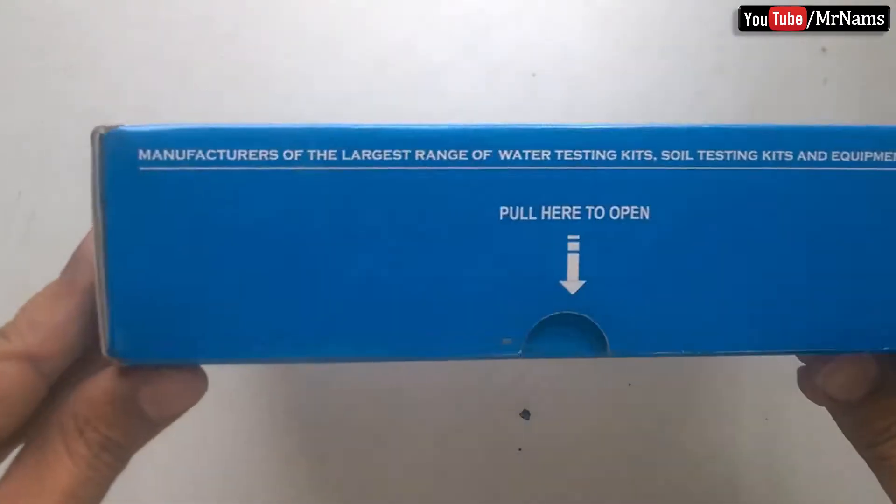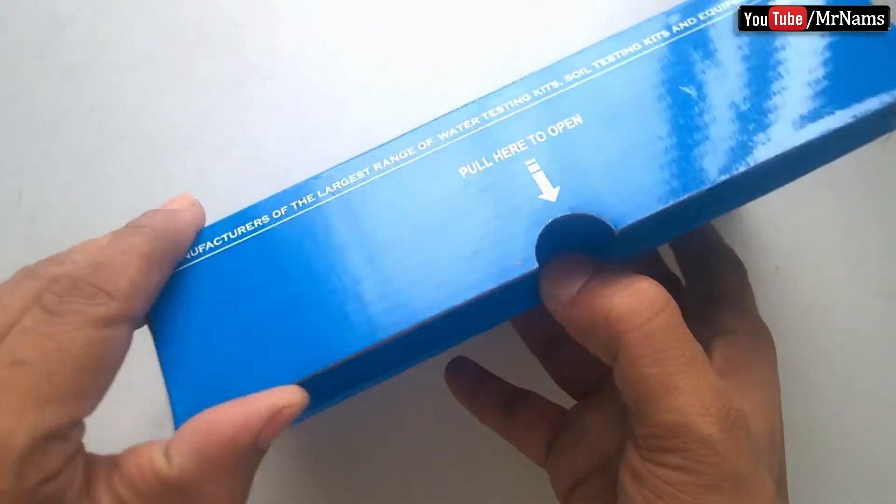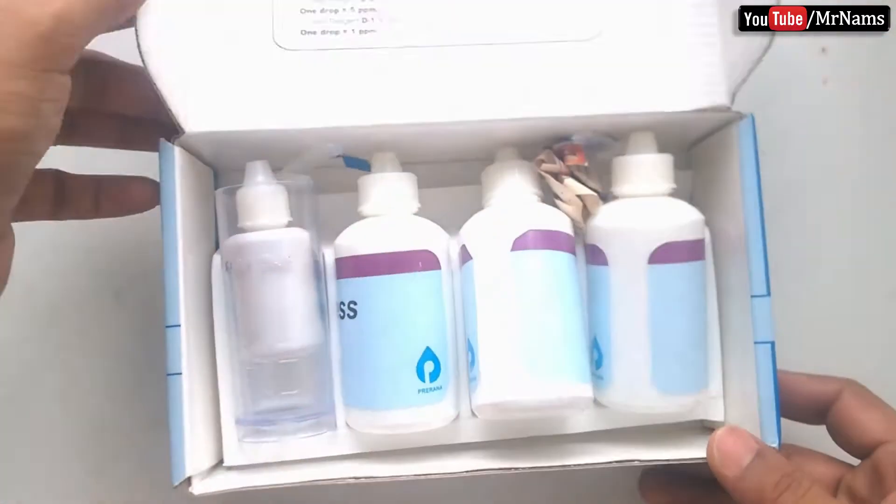Hello friends, in this video we shall learn how to use a water testing kit for water hardness measurement.